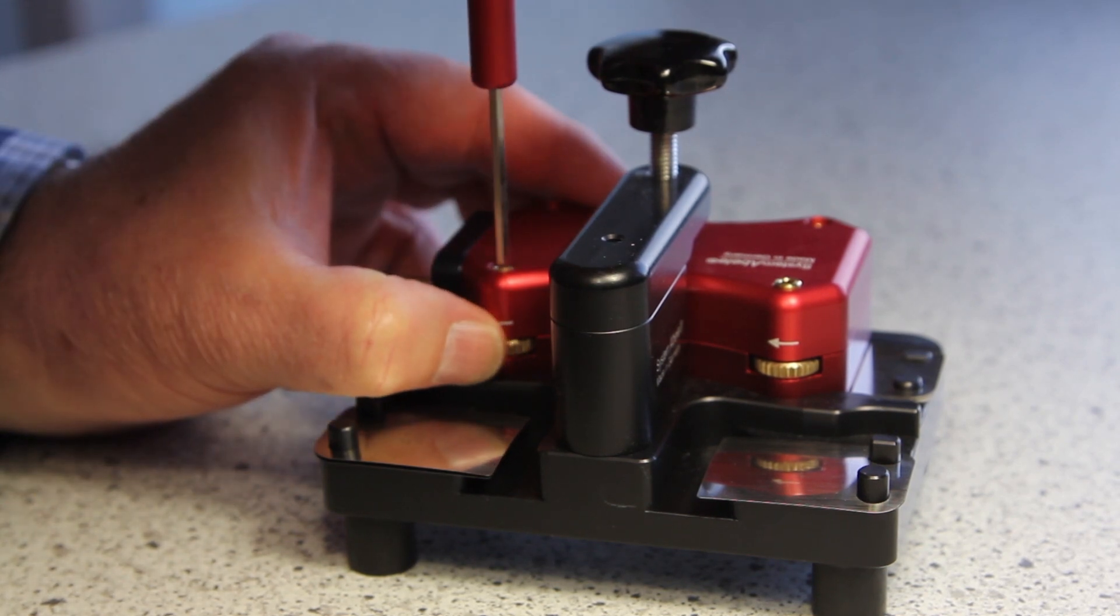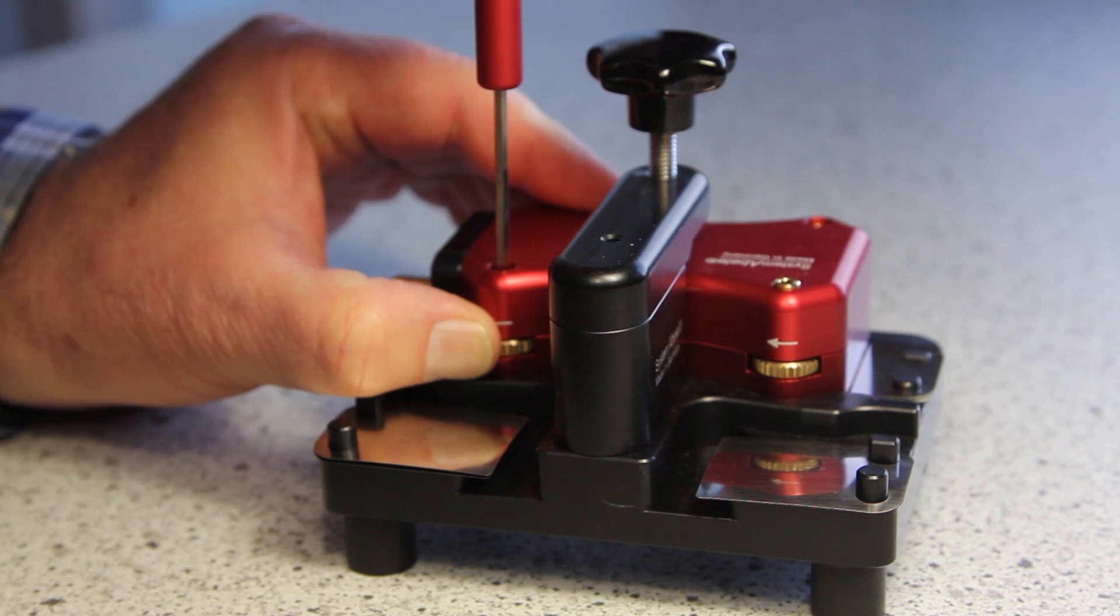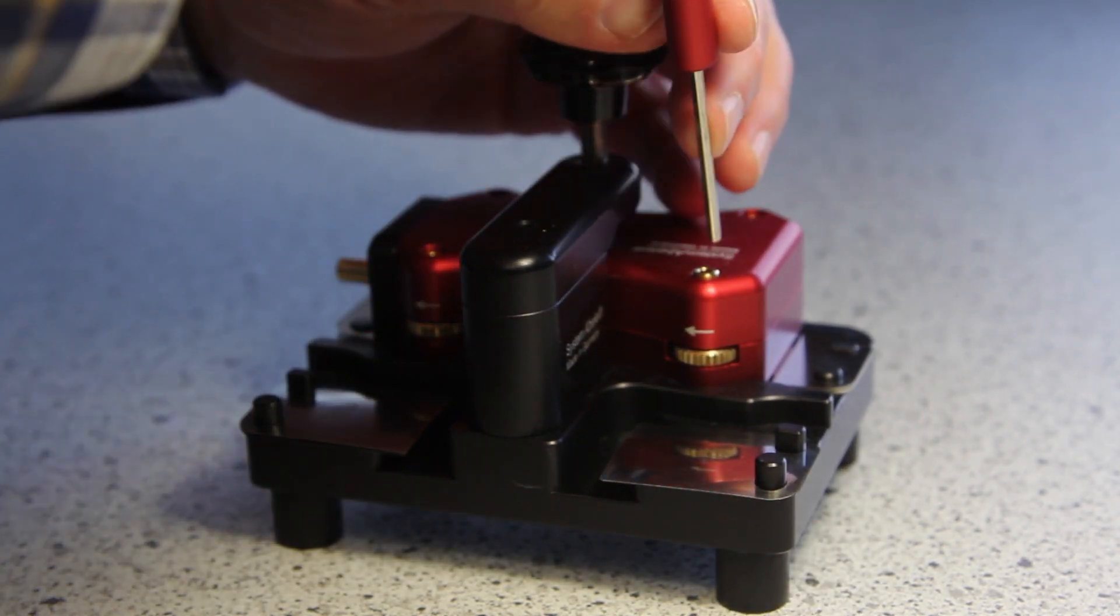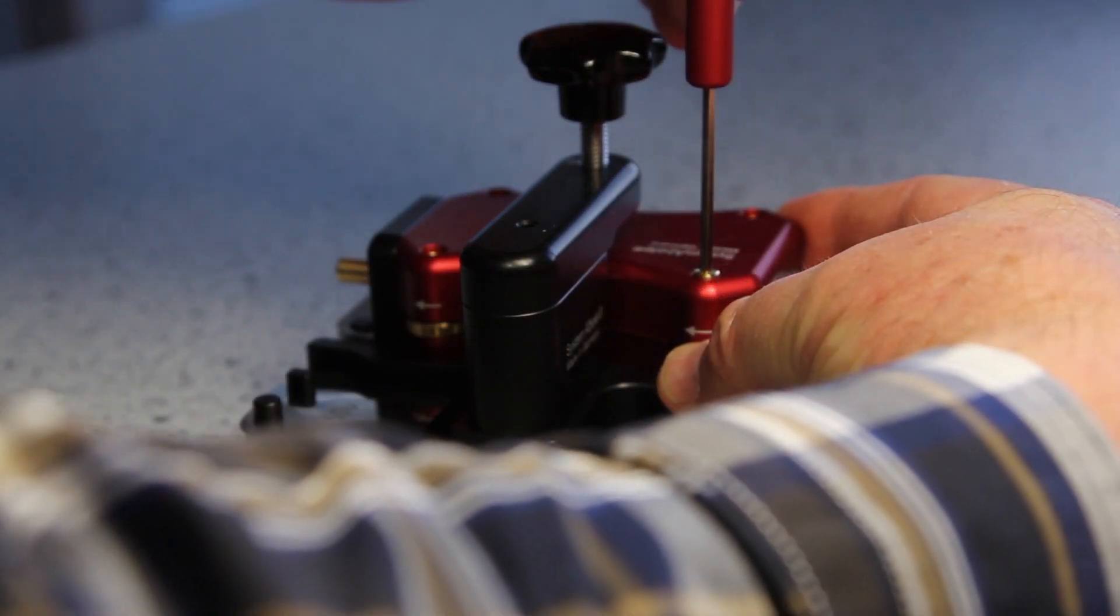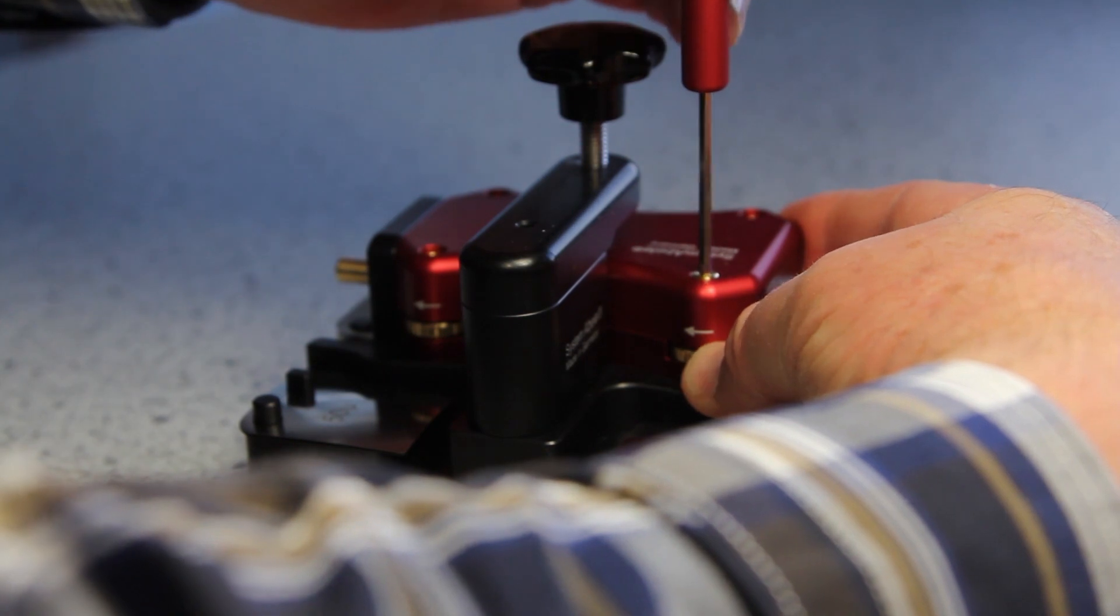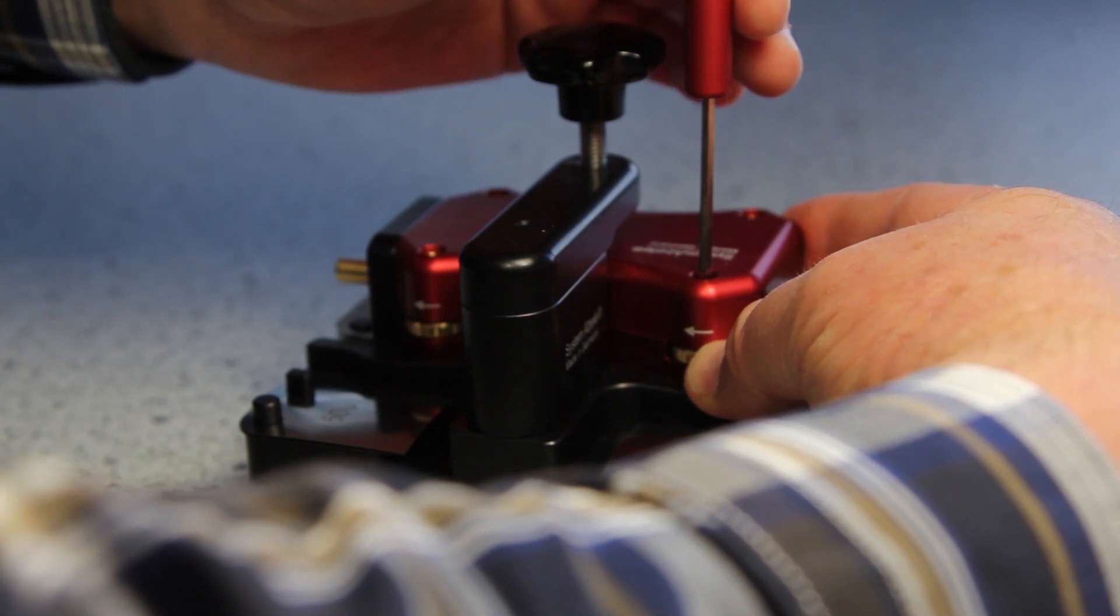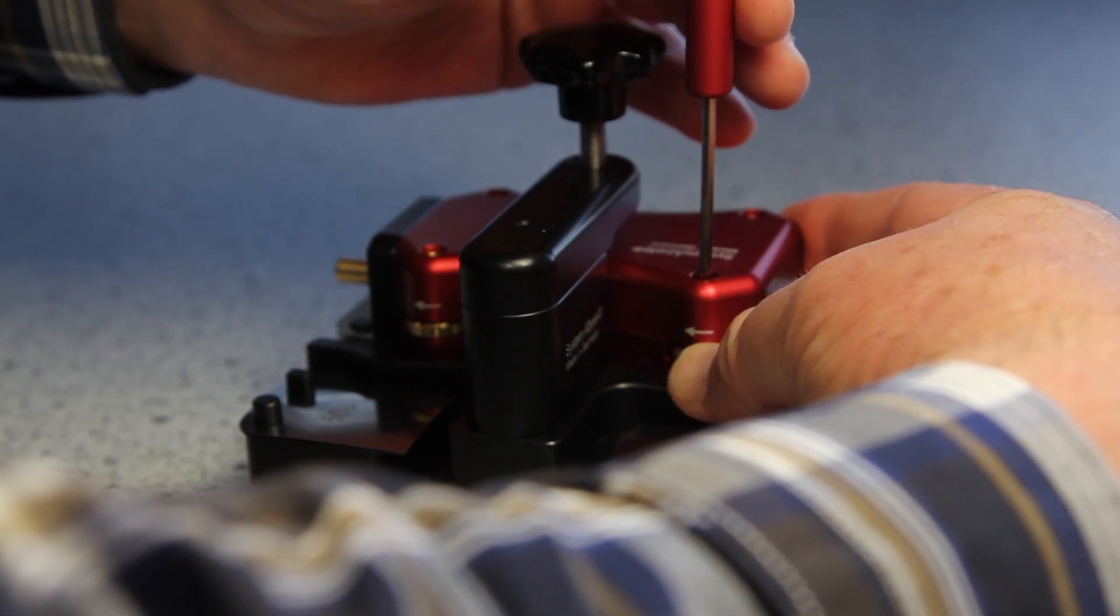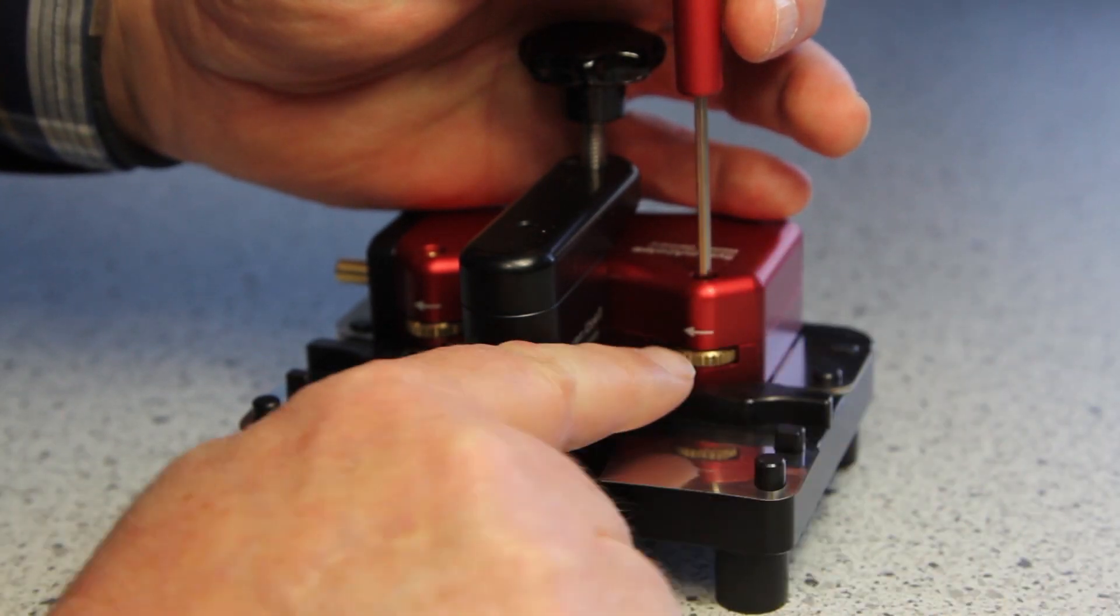I turn it down. I move the counter nut. And when I am down I turn the foot with two fingers and I counter. I do the same on this side. I move the counter nut, I turn down the foot. And when I am down I counter in the direction of the arrow.